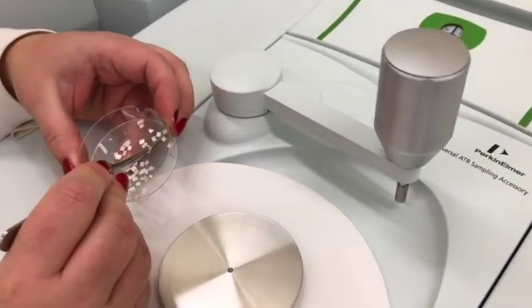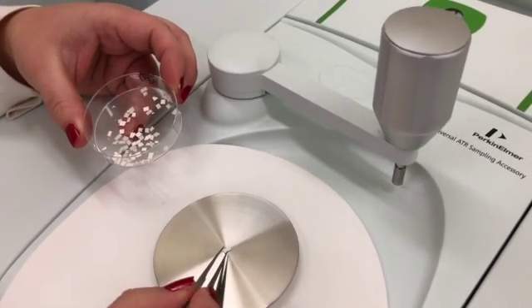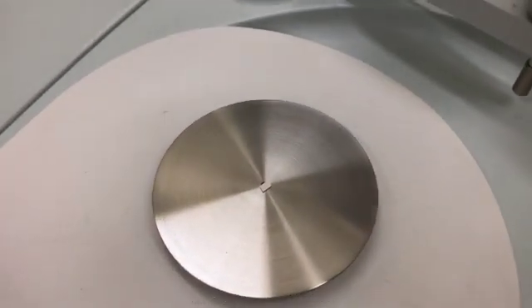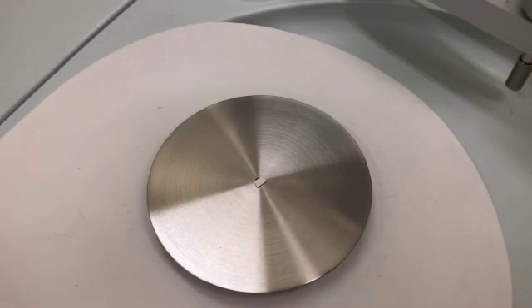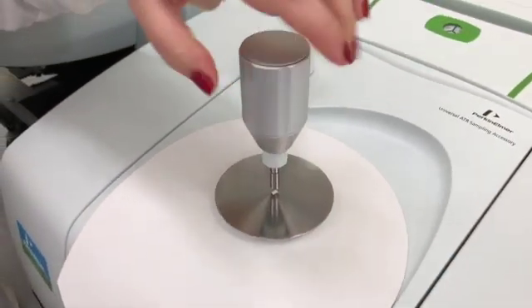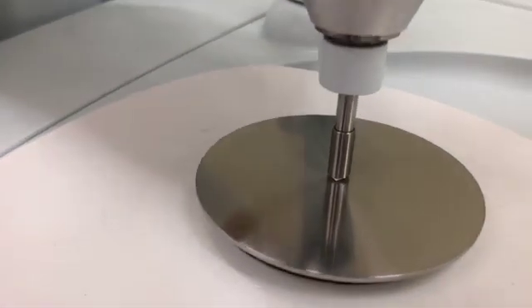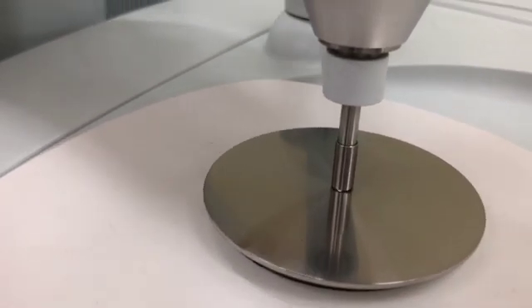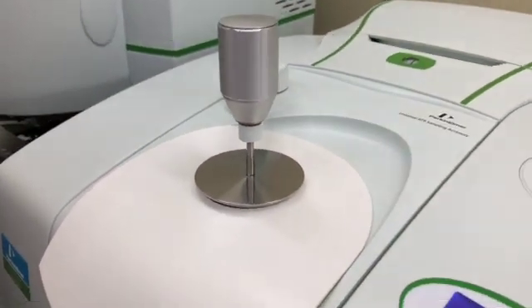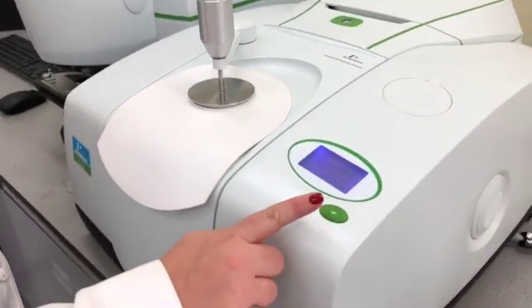We will take one of the paint chips or fragments and place it on top of the diamond ATR, making sure that it's right in the middle. We will then take the pressure gauge and push that down to a certain point, which will be identified on the screen that I have mildly forgotten to show you.